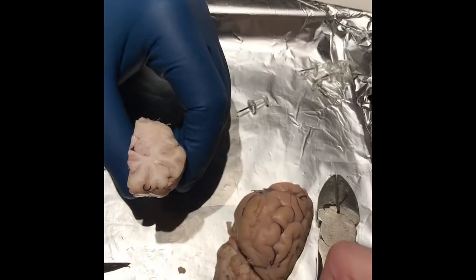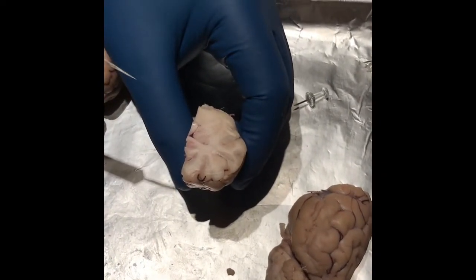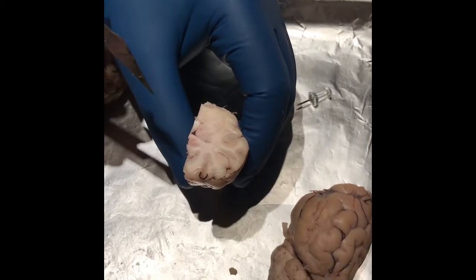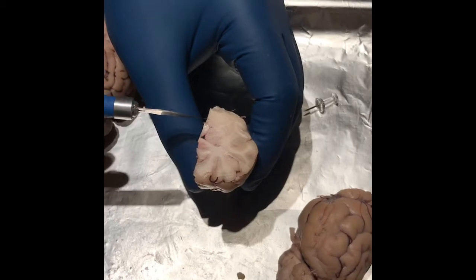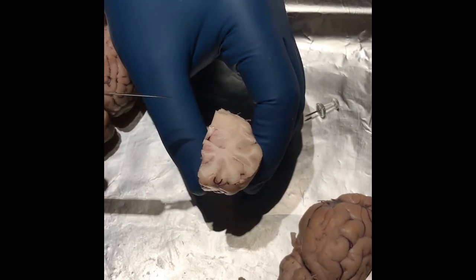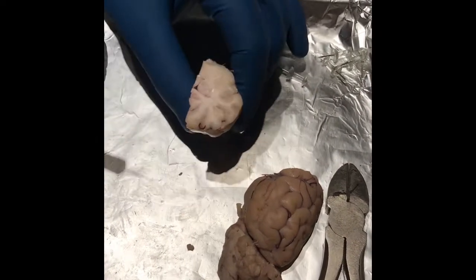The nucleus is actual brain matter. Okay. And then the putamen would be more on this side, correct? And then the globus pallidus, did I say that correctly? Yes. Would be more on the inferior portion of the brain. And then the anterior commissure might be seen on that other piece. It's kind of hard to see on this piece.